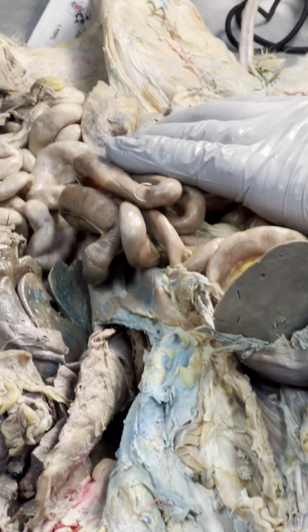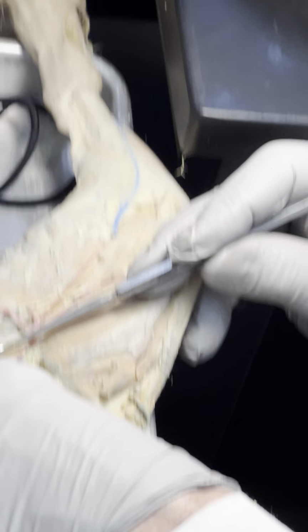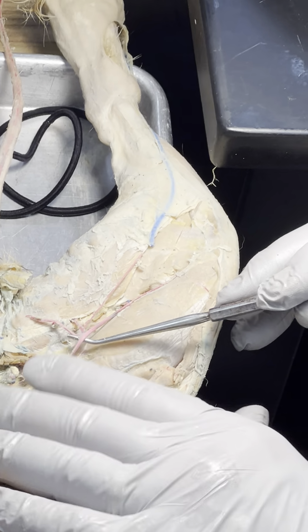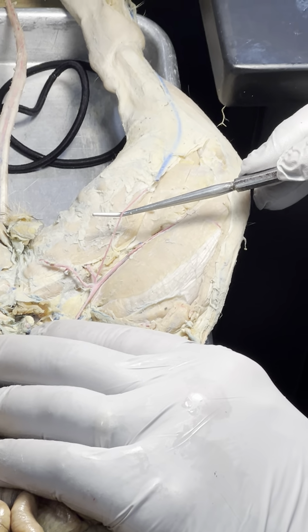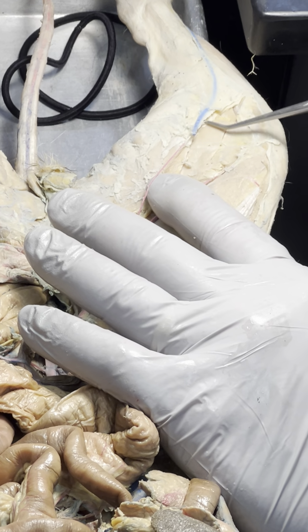We got everything happening that way on the right side. We already did external iliac, internal iliac, and caudal. So what's this one? A deep femoral on the right. Here's the femoral for the right. Now everything's going to flip you around here, but that is saphenous because it's going all the way down the leg. Notice how it ends up going underneath the vein.